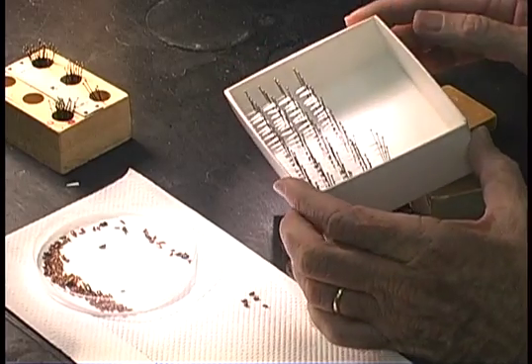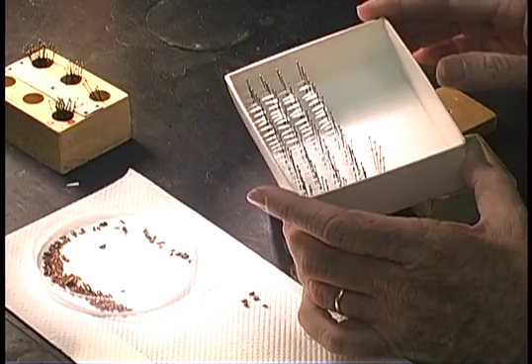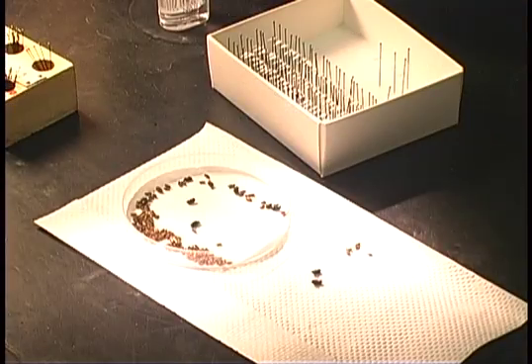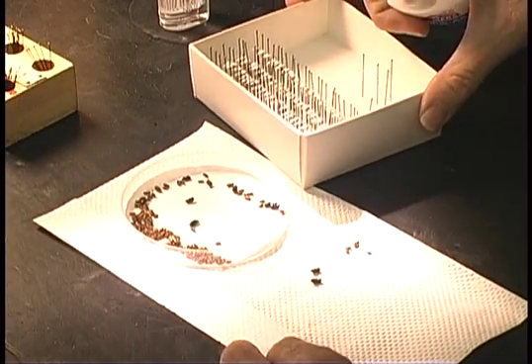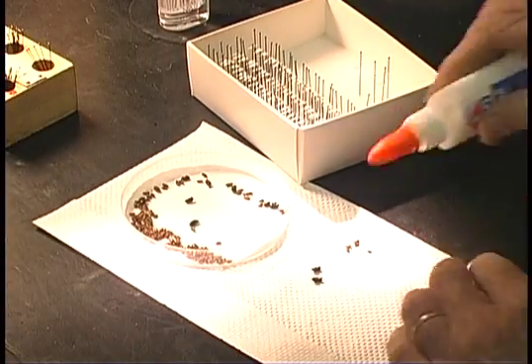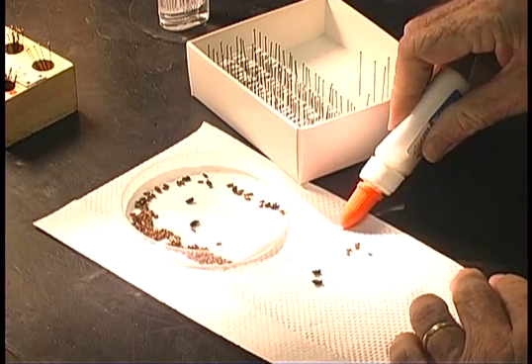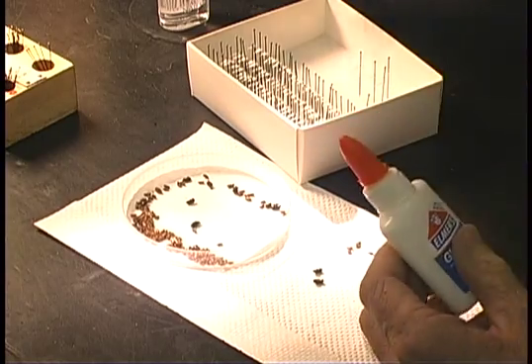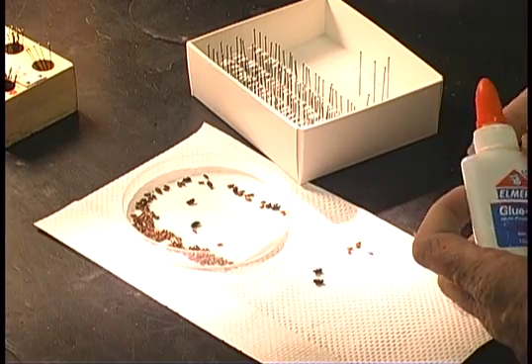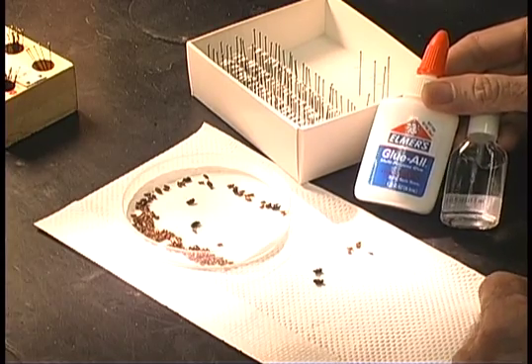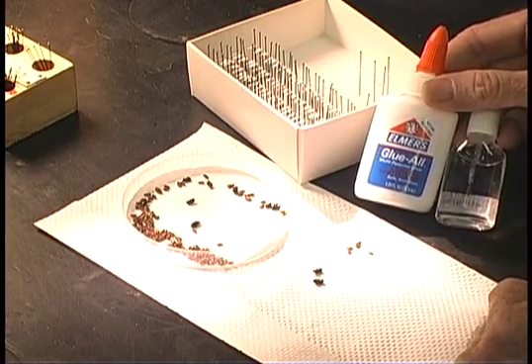So the first step is to make yourself up a number of points. There are some special tricks to point mounting successfully. Most people believe that point mounting is particularly difficult, but actually it is quite easy with a little practice. You don't really need any special types of glue to do point mounting.